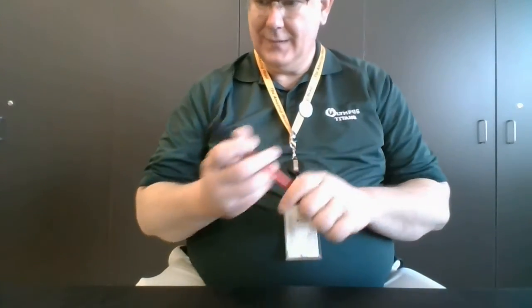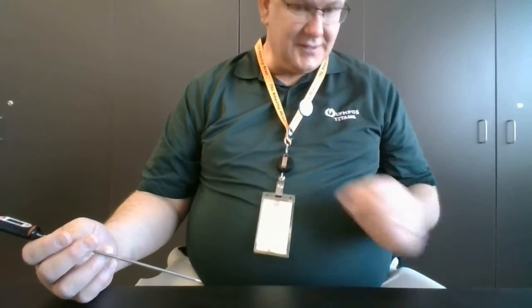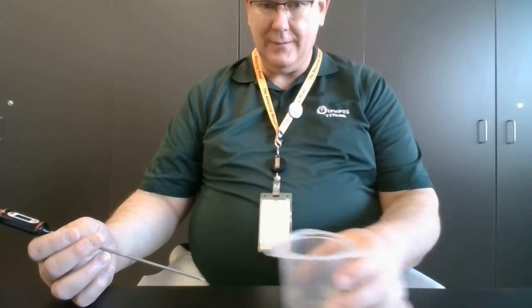Hey everybody, this is Mr. Martin, and this is the kinetics lab where we're dissolving an Alka-Seltzer tablet in different temperatures of water.